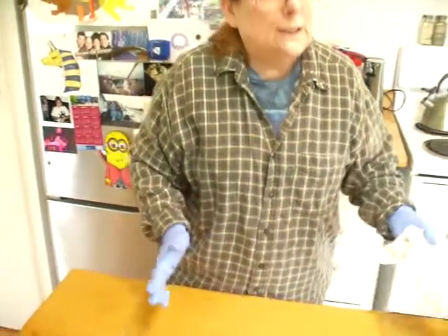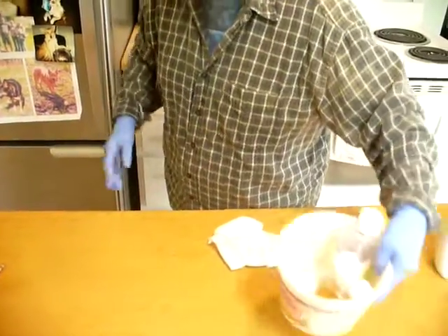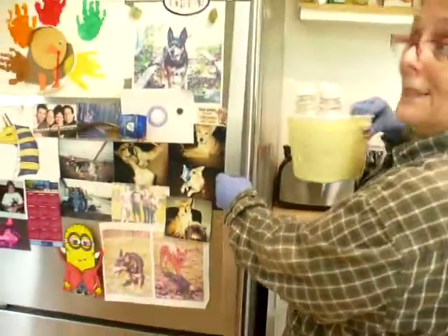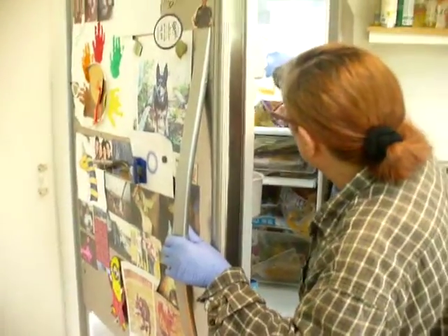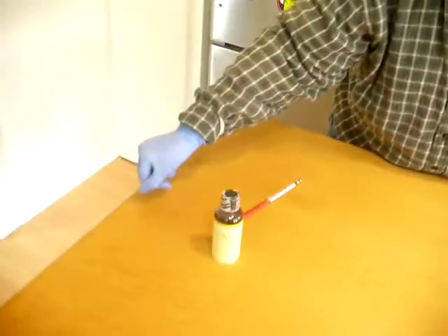Part 4: cleanup. I'm going to set down my paper towel and pick up my test tube rack. Remember my test tube rack — it's got my cultures in it. I'm going to put them in the incubator; my refrigerator is my substitute.